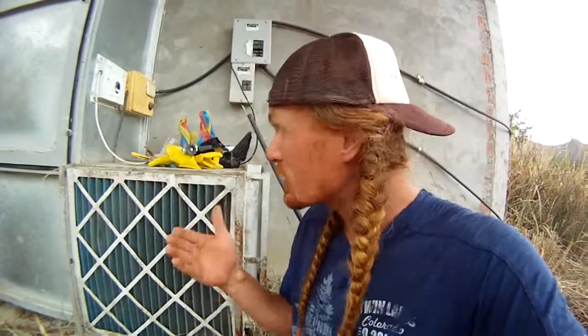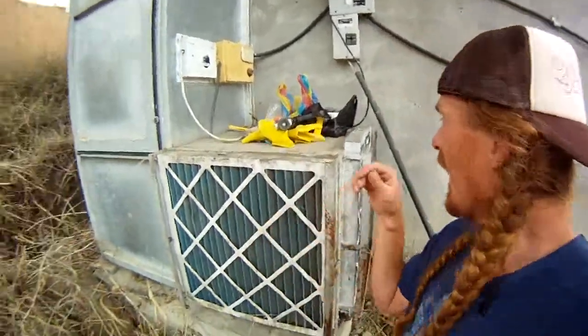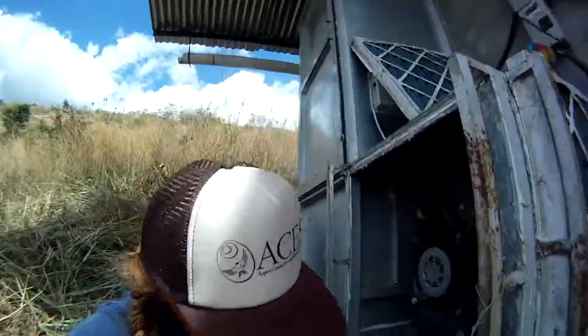It's a series of filters adding longevity through all your filter stages, the last one being a HEPA filter. Mine is a 12-inch thick HEPA filter. Those are somewhat spendy, and I'd like it to last as long as it possibly could, so all your pre-filters are protecting that. Also, I'm protecting a little bit my squirrel cage blower that provides the airflow here. These are obviously on the suction side. I've got two flow possibilities.